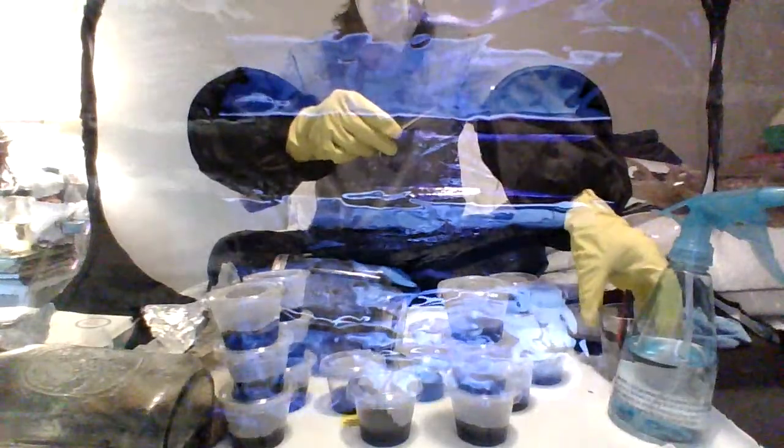All right, so I'm pretty much already done, but I'm gonna do at least one more, and I'm gonna show you on a condiment cup, okay? I'm gonna clean up these nasty scissors. I kind of gooped them all up. Goopy. All right, we're gonna try that again, and I'm gonna try to do a better job of it because I didn't do very good. We're gonna do it in a condiment cup this time.